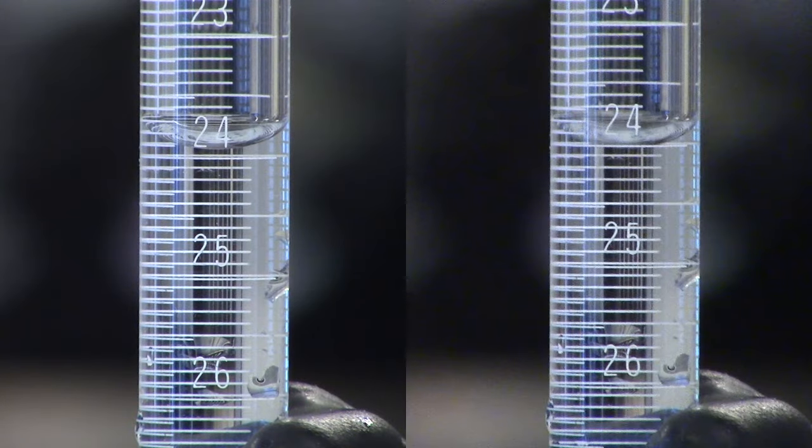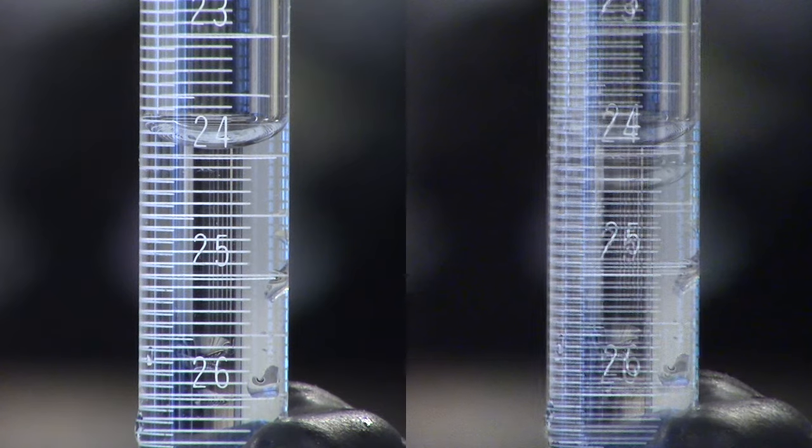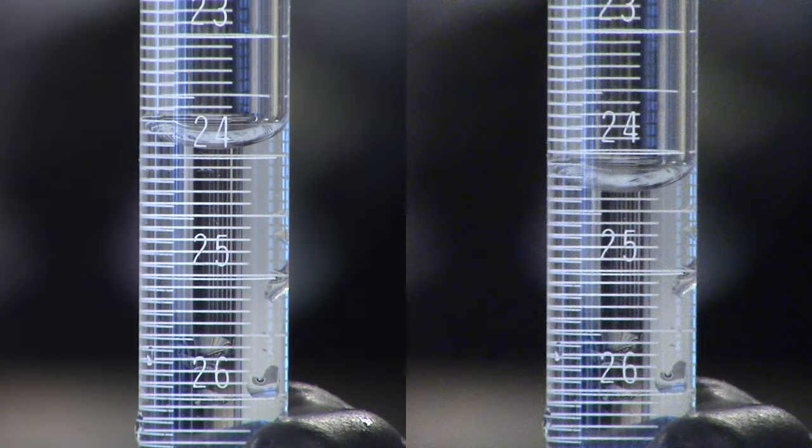The volumes of sodium hydroxide should agree within 0.2 mL. If it is not, perform a third titration.